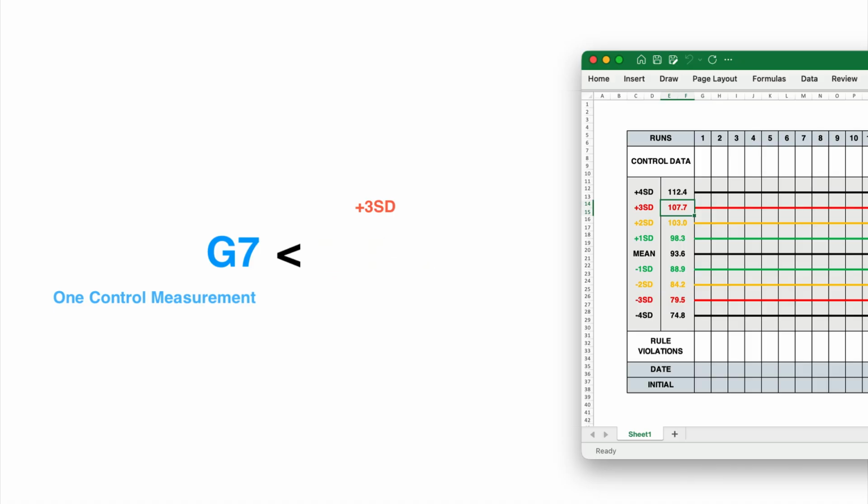Condition 2 is the opposite. The value could be lower than the lower limit, which is mean minus 3 standard deviations. That limit is stored in cell E26. So if G7 is less than E26, condition 2 is true.